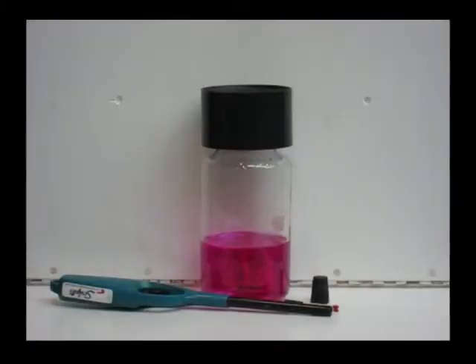The beaker contains water, phenolphthalein solution, and one drop of 2 molar potassium hydroxide. There is also a hole in the lid that will allow the insertion of the grill lighter.